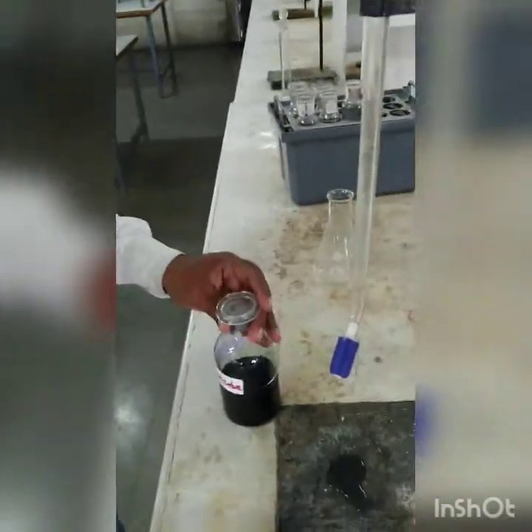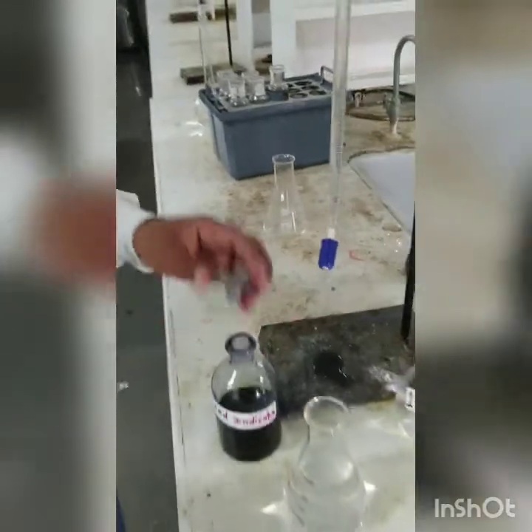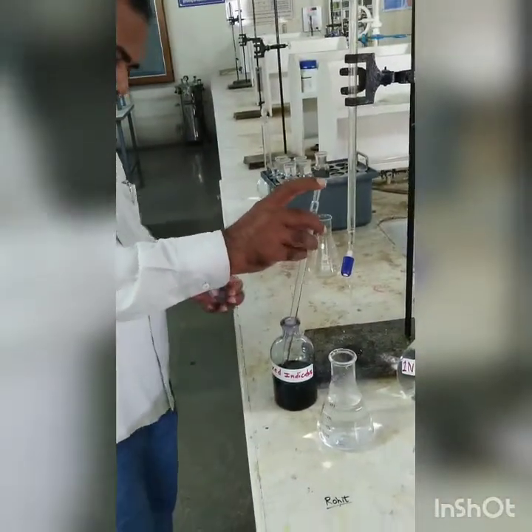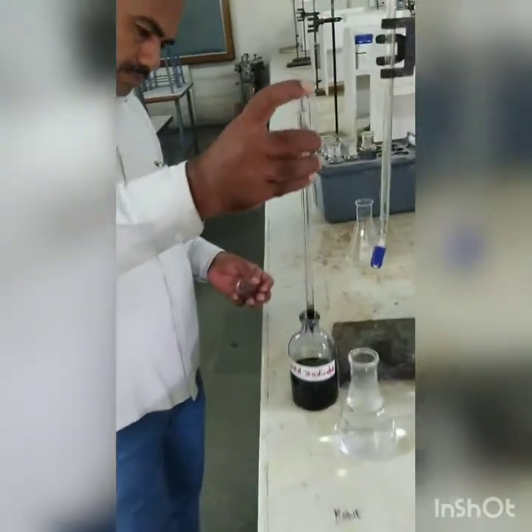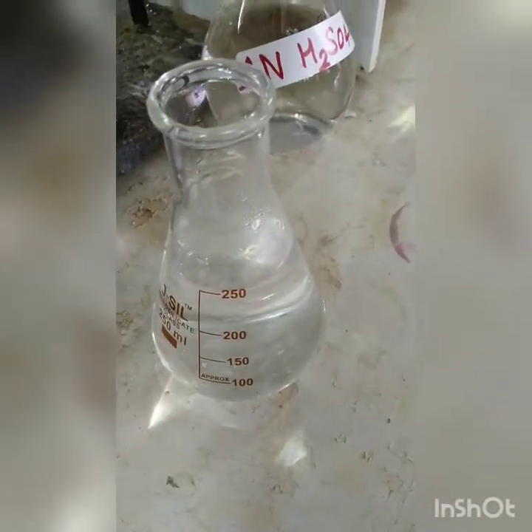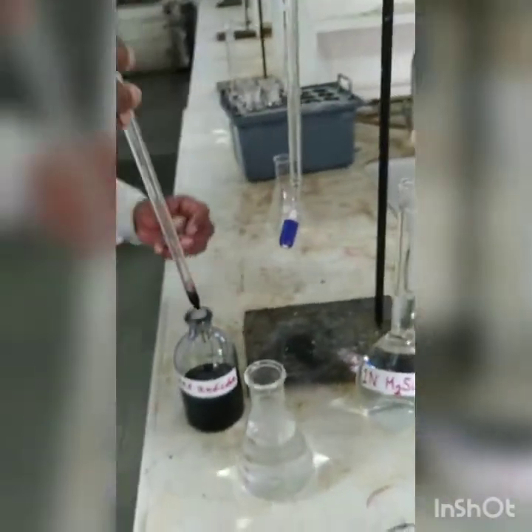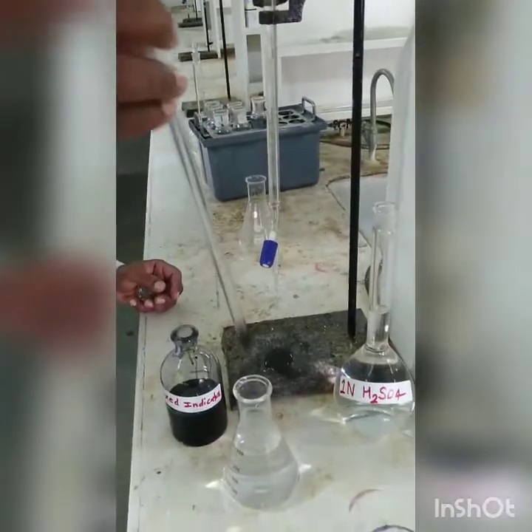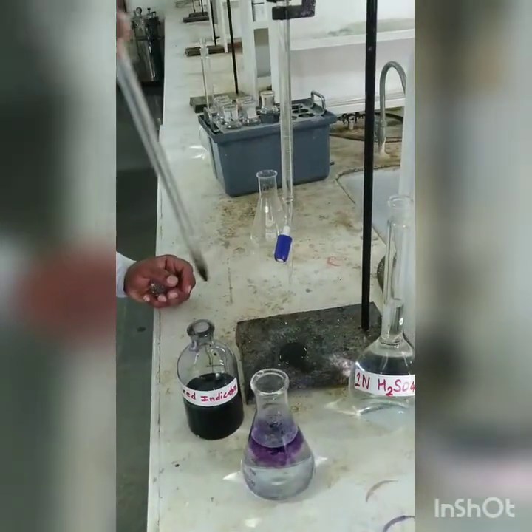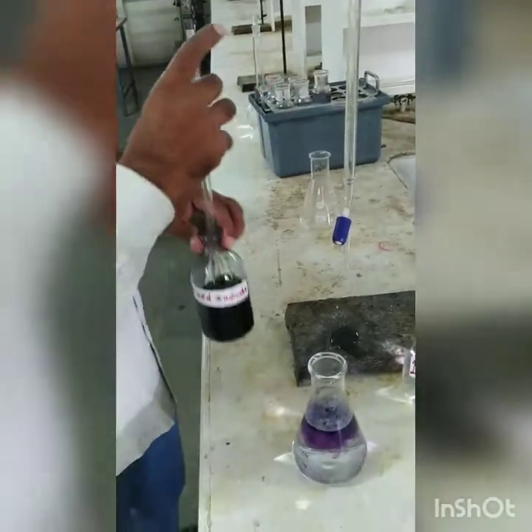Students, now we are here with the final titration of our total Kjeldahl nitrogen experiment. We are starting with the digester sample first. We have 250 ml of the sample: the distillate part is 200 ml, and 50 ml of boric acid was there earlier. Now to that we are adding about 0.5 ml of mixed indicator.